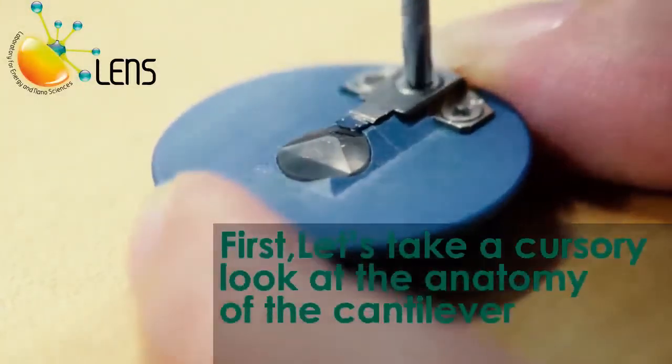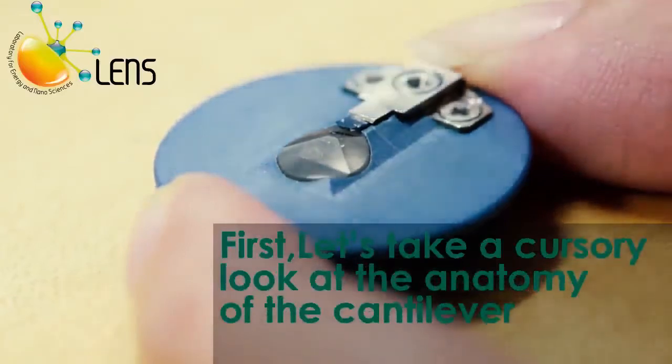Inserting the cantilever into its holder is a critical part of the calibration process in AFM imaging.